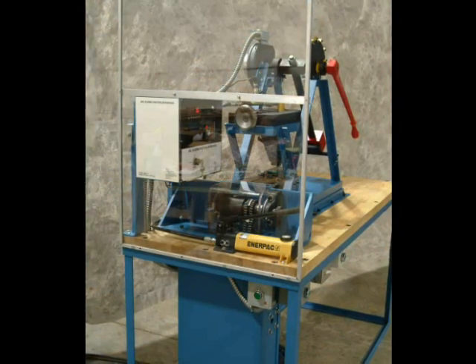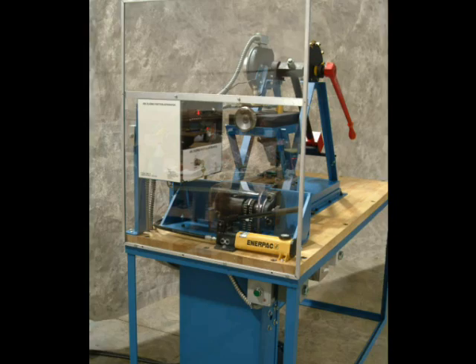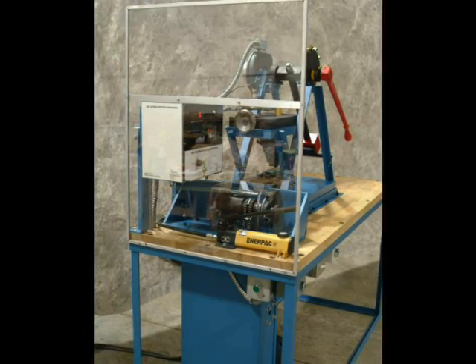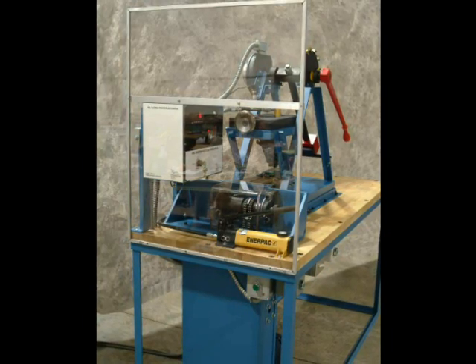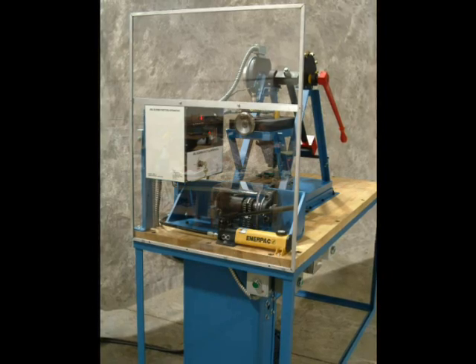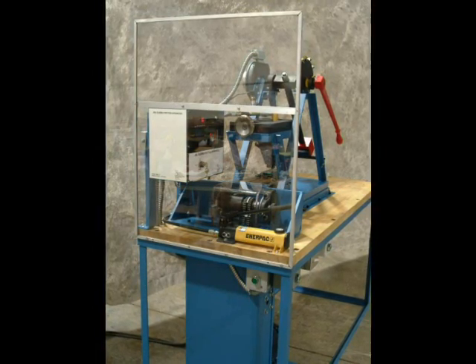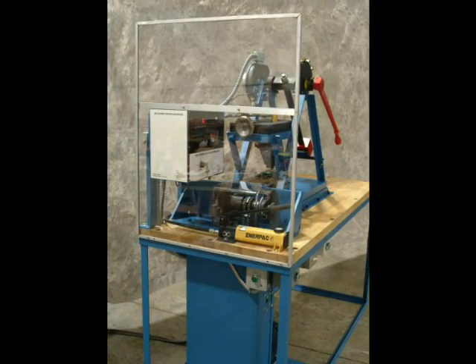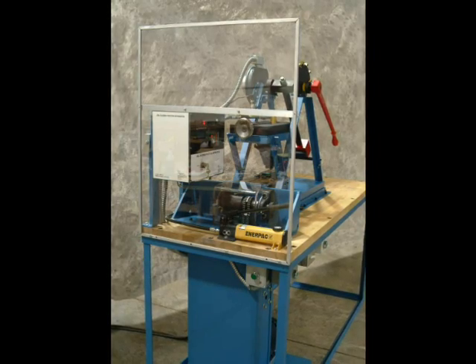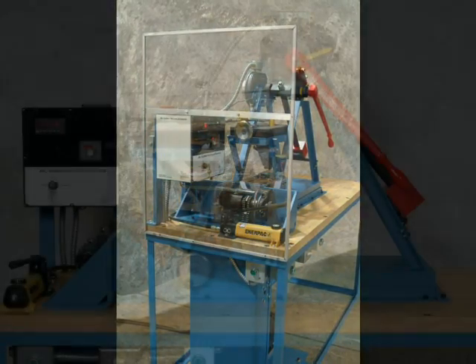One benefit of the ABL friction test machine is the ability not only to control the force applied but also the velocity of the sliding anvil. This is a desirable feature in that it can simulate processing and handling equipment. With the data obtained, the user can determine the safety of operating their machinery at a given speed.